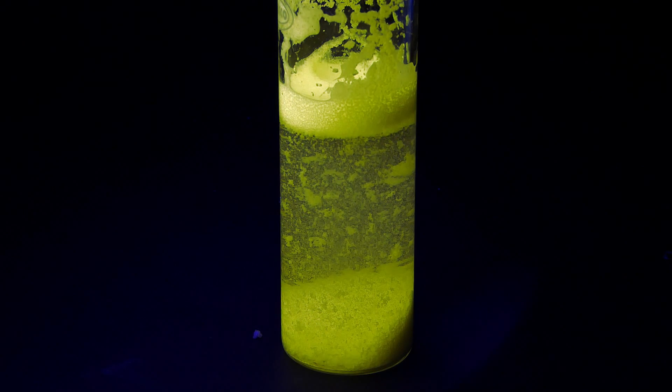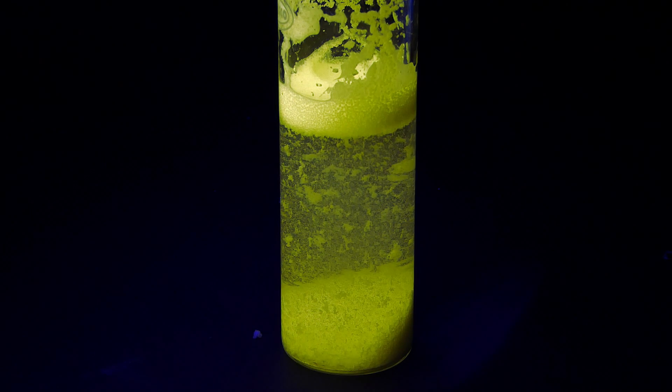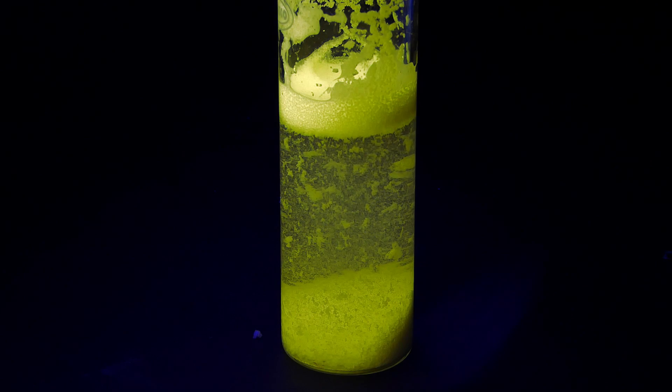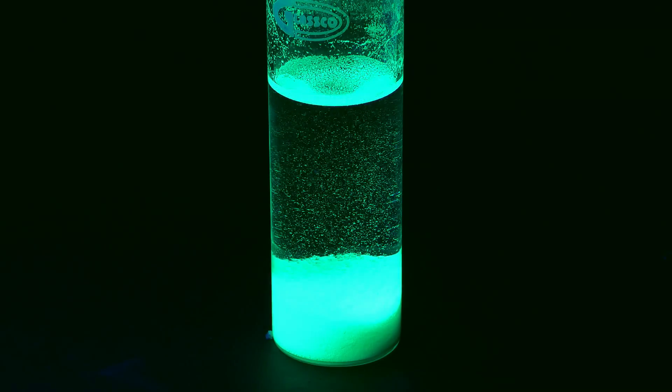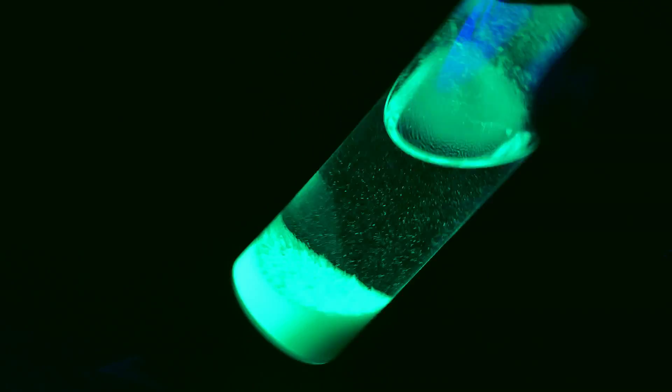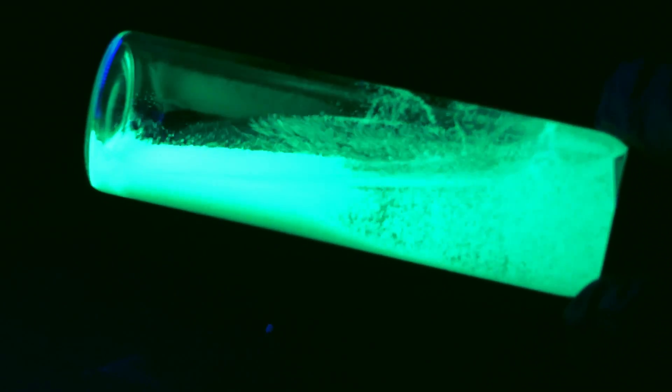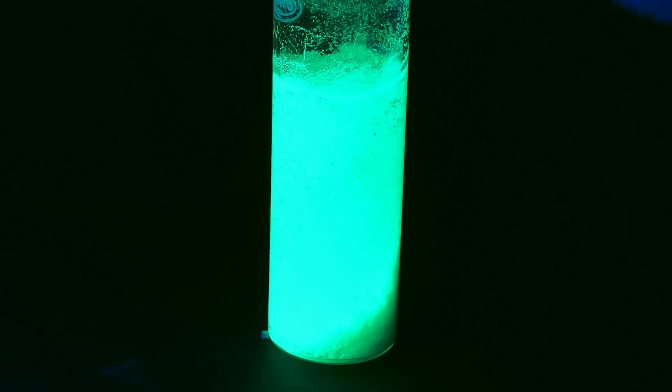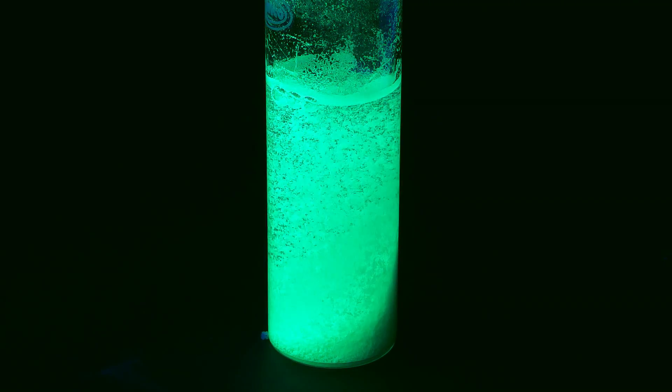The color that they give off is green or blue, but here it is also a bit of a problem, because I already did a few test runs for this video to make sure that everything is working, and I never seemed to be able to make the blue one, and its synthesis always resulted in the formation of the green complex. If you guys know how to make the blue one, you can tell me in the comments, and now it is time to make the green complex.